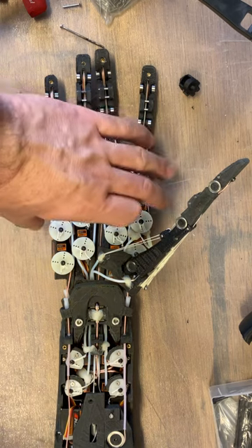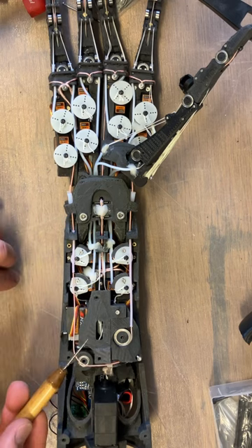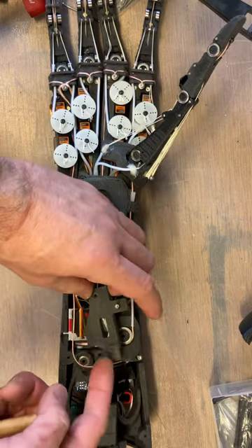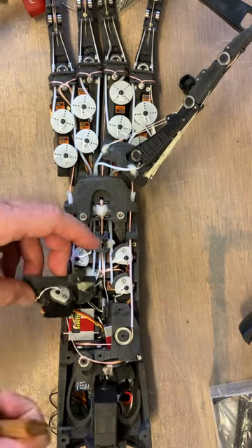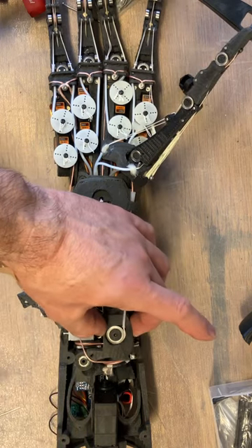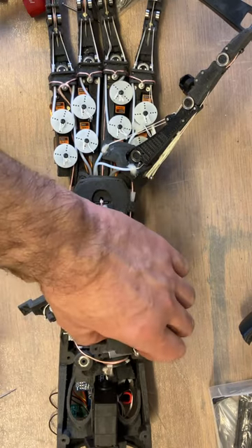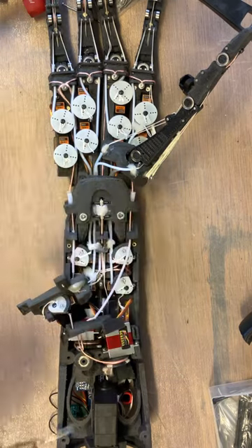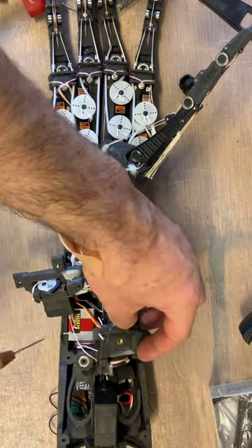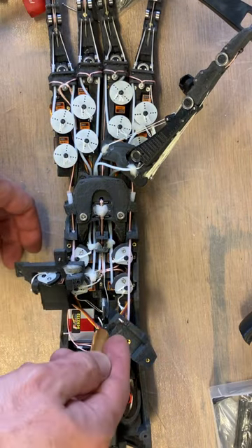We can have a quick look at those. To get these open, you have to unhook the wrist tendon — yes, it's a tendon. Then this one lifts up, which has one servo attached to it, and as you can see it's moving the thumb. There's a screw here, and this section is actually pierced by the wrist tendon. You can now see there's one more there, and this one here, and then two more buried — you can just see where the tendons attach here and here.